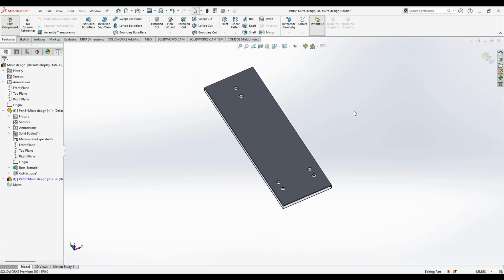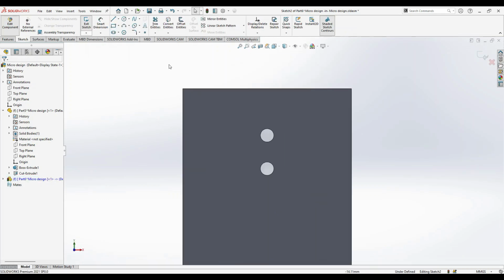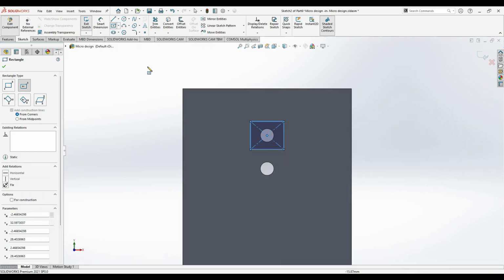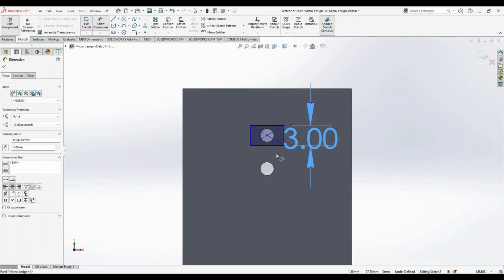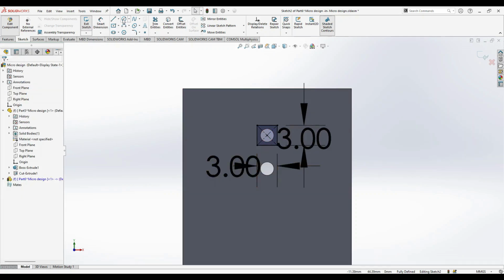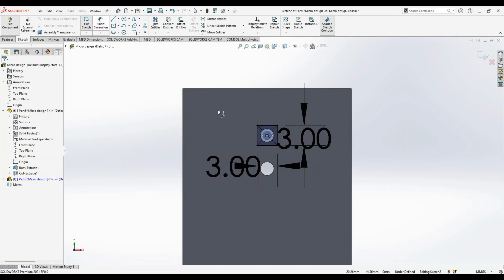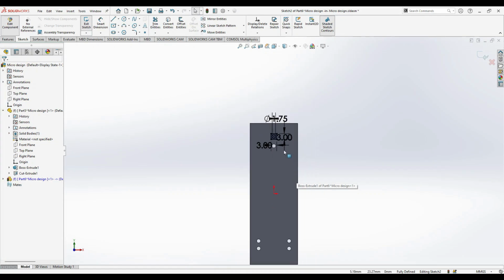Okay, so now on the top of this, we want to create an inlet for our tubings to enter. So what I do, I'll create a center rectangle, and you can use a preferred length. I prefer 3 x 3. Okay, and you can have the diameter as 1.75 because my tubing diameter is 1.75. Okay, and everything is done.